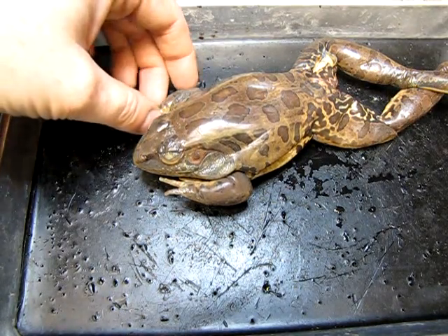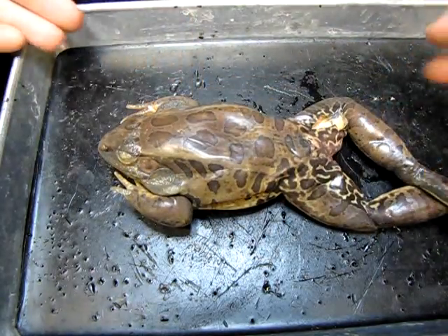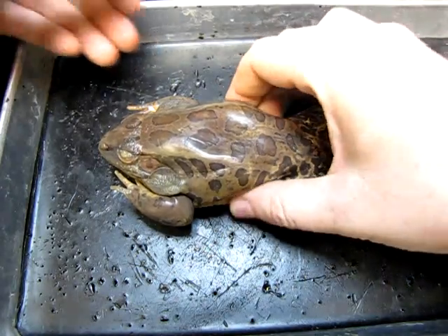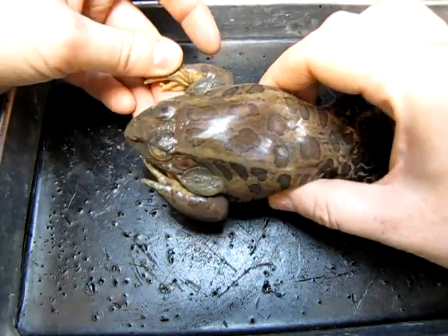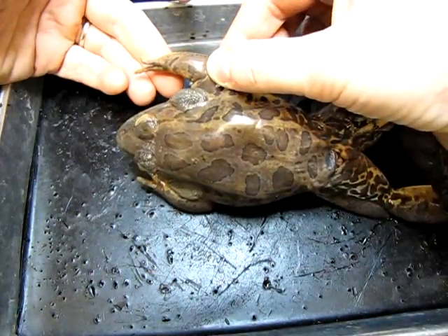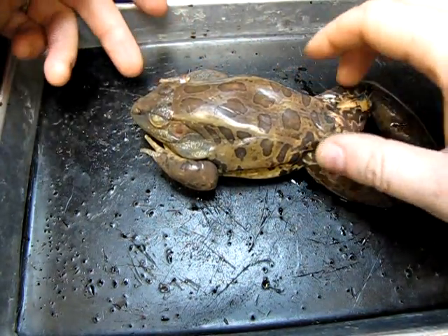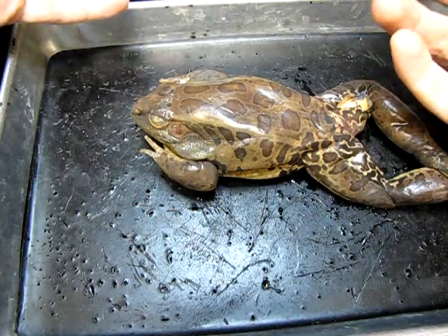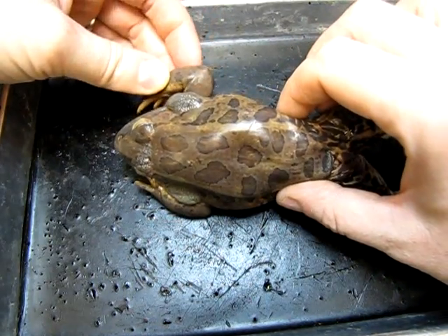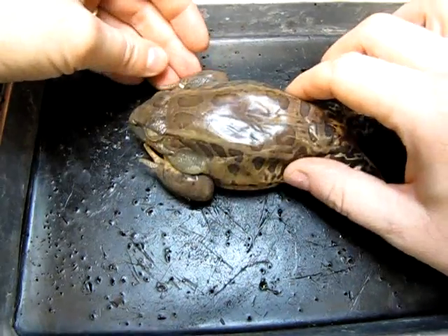The limbs of the animal are clearly modified to perform different functions. The forelimbs and the hind limbs look quite different. The forelimbs are very short and stout, still very muscular — you can see how broad they are — but they're not particularly long. They're used when the animal is sitting and walking, and they're also used in handling food, so the frog can use them to push food into its mouth.